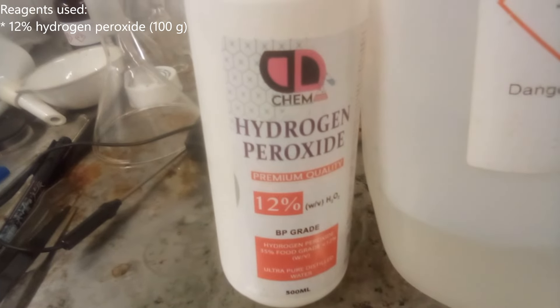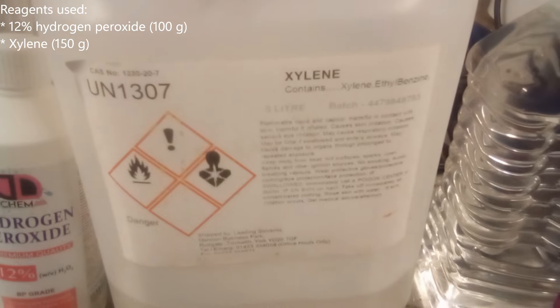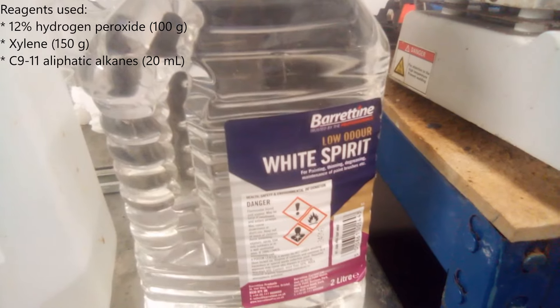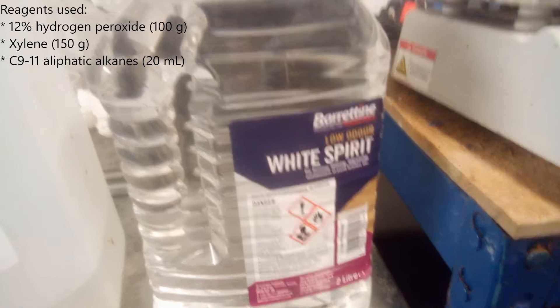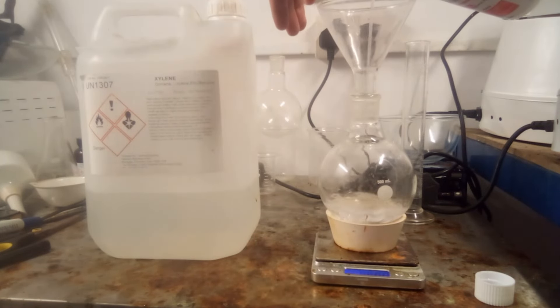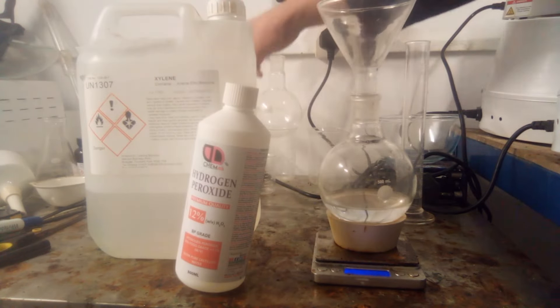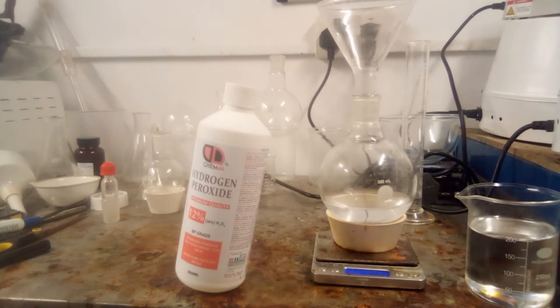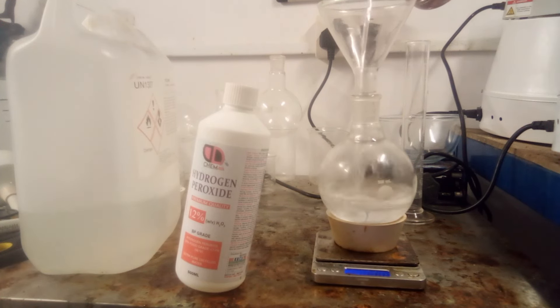The reagents used were 12% hydrogen peroxide at about 100 grams, xylene at 150 grams, and C9 to C11 aliphatic alkanes also known as low-odour white spirit, 20 ml. As an aside, you can clearly see the hydrogen peroxide bottle leaning to one side — the base is not flat because the bottle was starting to blow before I even received it, due to the peroxide slowly decomposing into oxygen, showing both that it's an unstabilised grade and that the bottle cap is not vented. I moved it to the fridge as soon as I saw this.